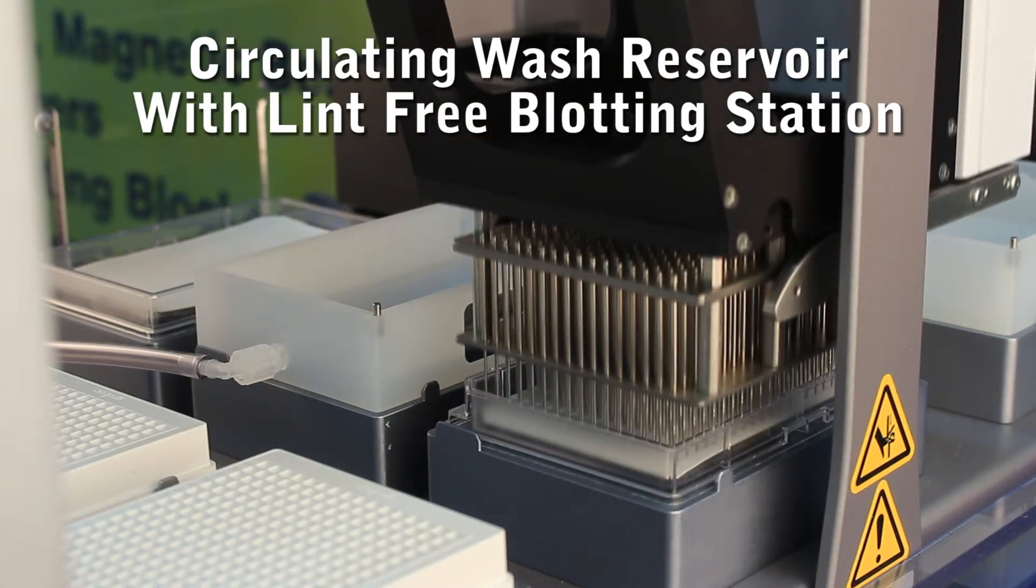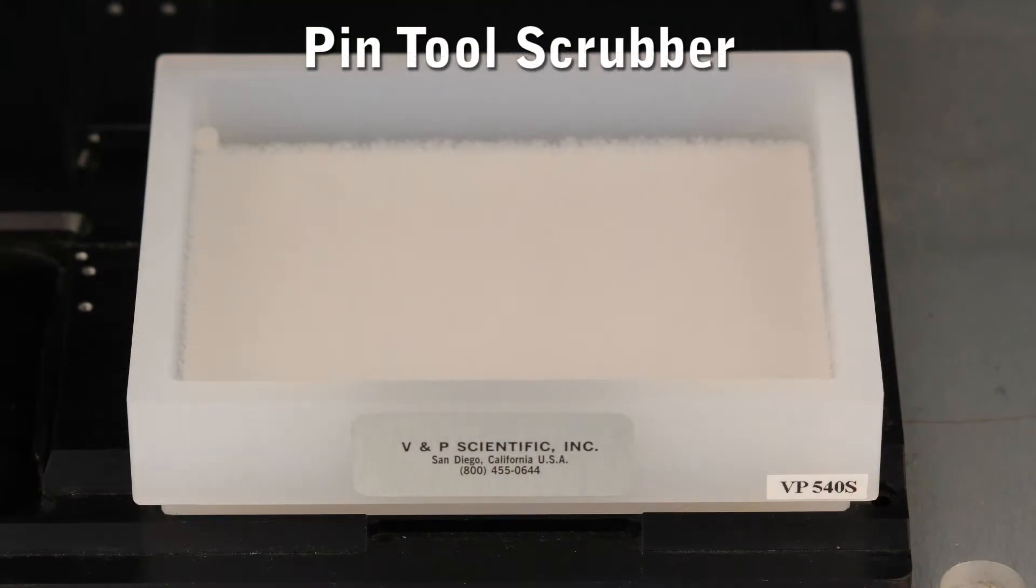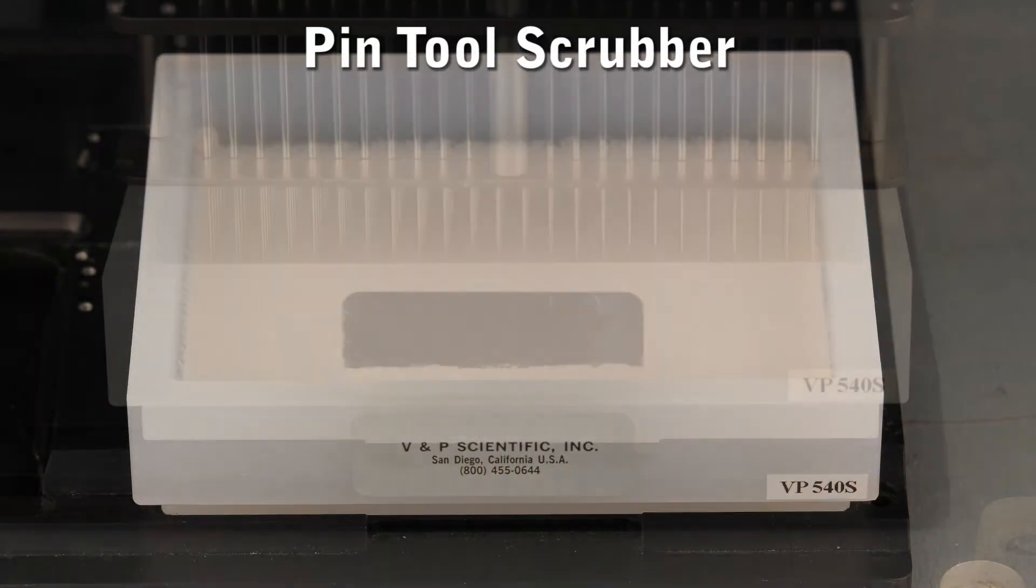Blotting the pins on the lint-free blotting paper is essential for reducing carryover. Our pin tool scrubber helps clean any hard to remove debris from the pins if needed.